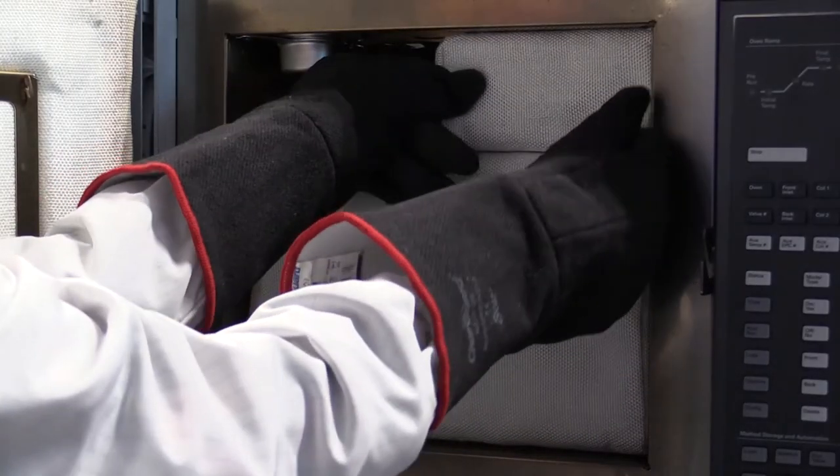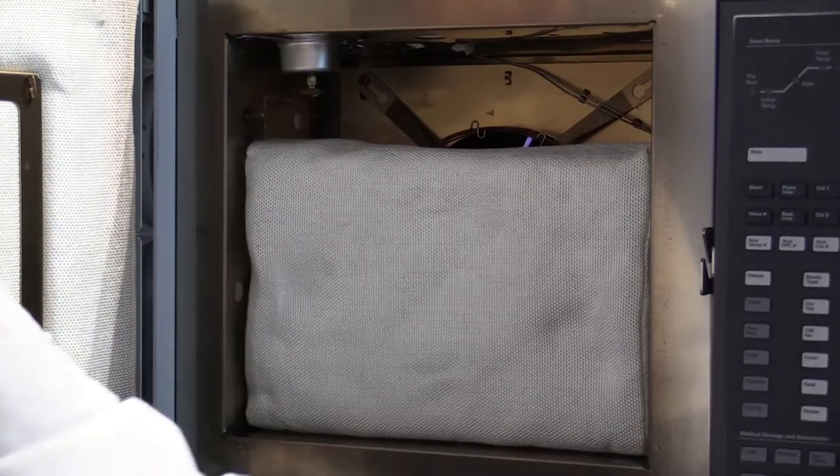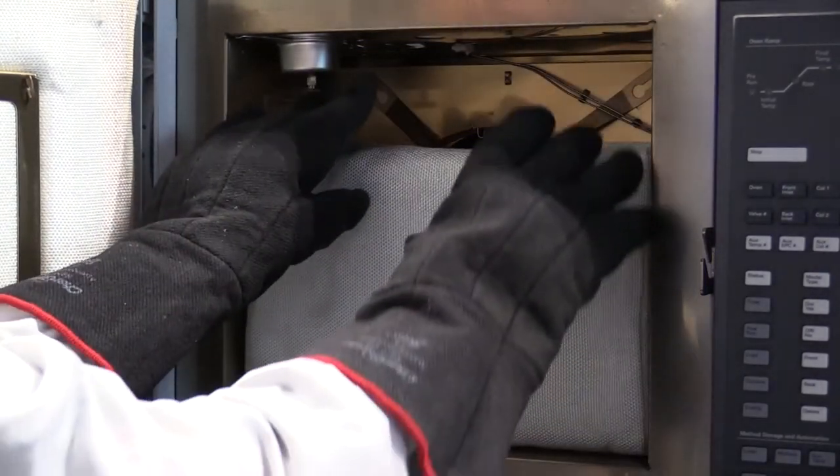Remove the block inserts carefully. Do not allow them to contact the column or the MSD source nut.